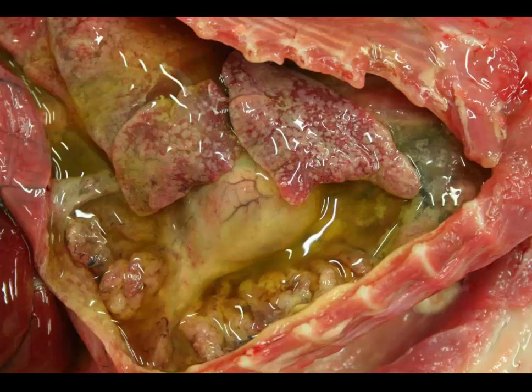Okay, time's up. A couple things to clue you into the true morphology of this lesion, and the number one most important thing is this pleural exudate. It's thick. It's high protein. It's almost honey-like in its consistency. And then most of the tissue, including the mediastinal tissue, the pericardium, and the pleura, are covered with a mat of fibrin. This should make you think about the disease feline infectious peritonitis.